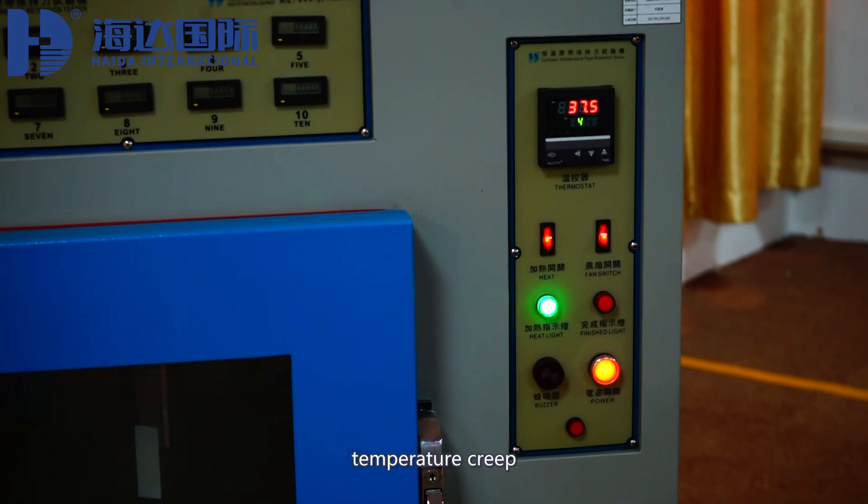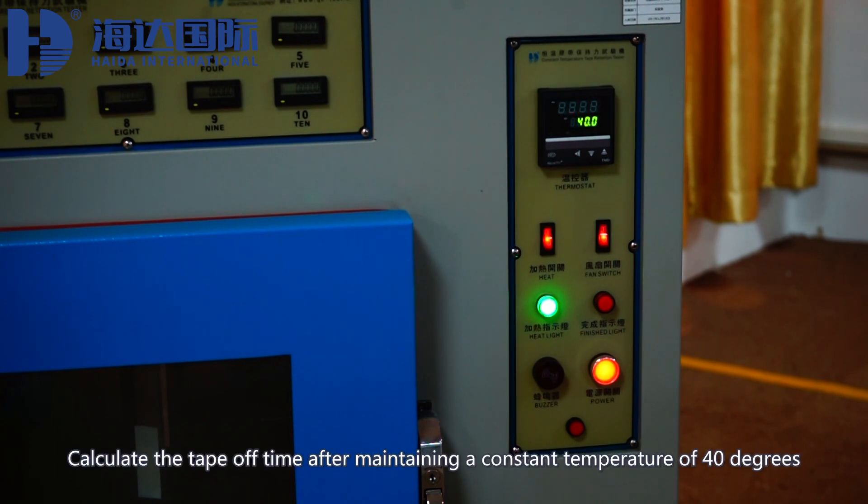Temperature creep. Calculate the tape off time after maintaining a constant temperature of 40 degrees.